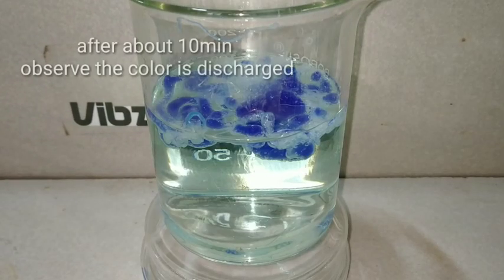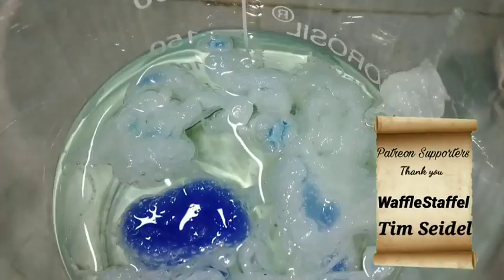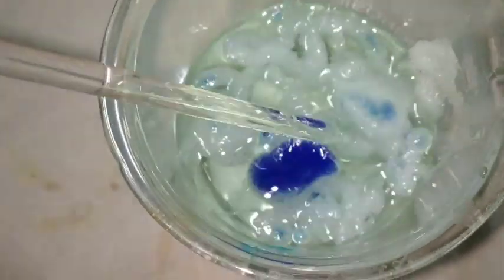You can see that on standing for approximately 10 minutes, the color of these threads has discharged and the solution is slowly turning blue. That is because the copper ions present on these threads have reacted with the sulfuric acid forming copper sulfate, which left behind the threads colorless.